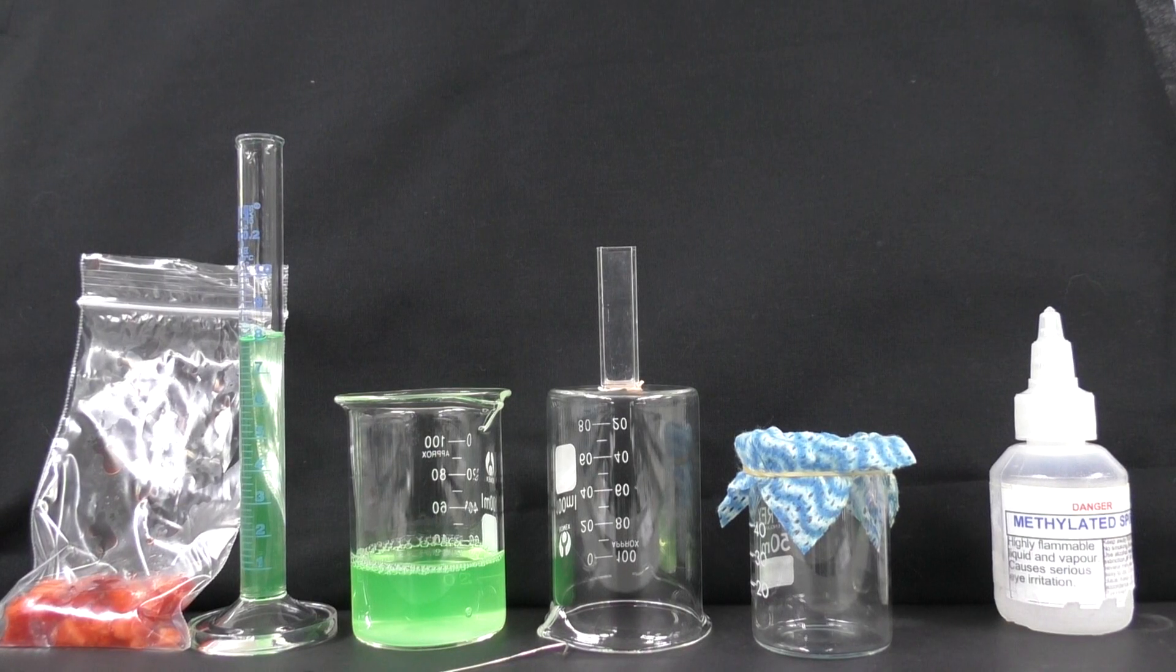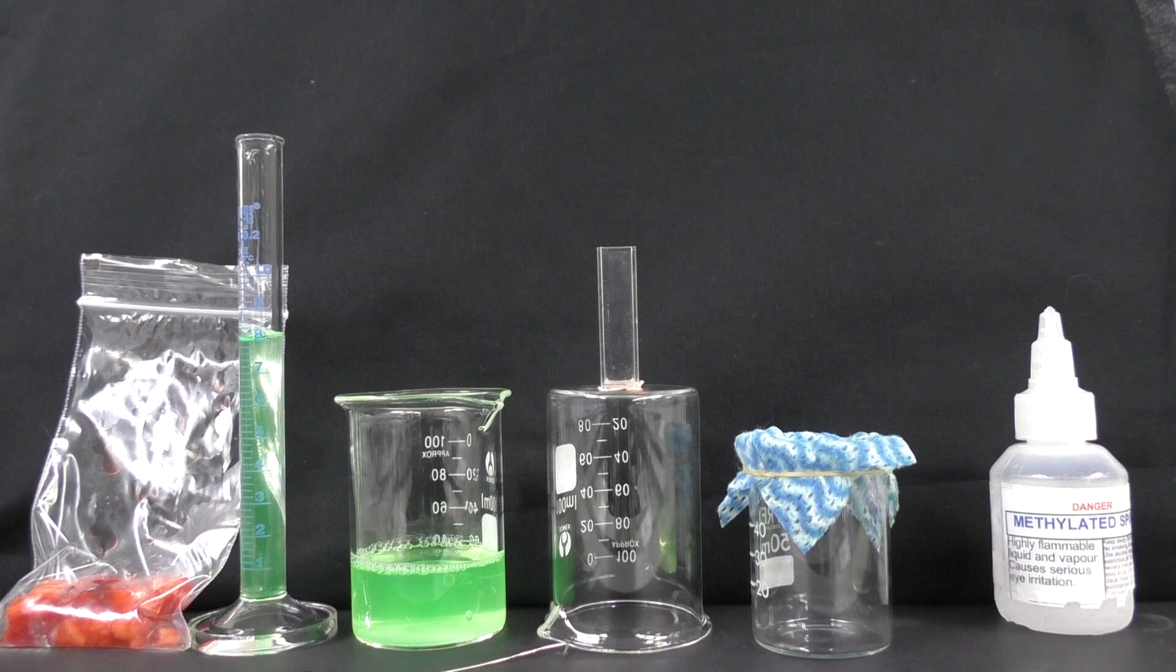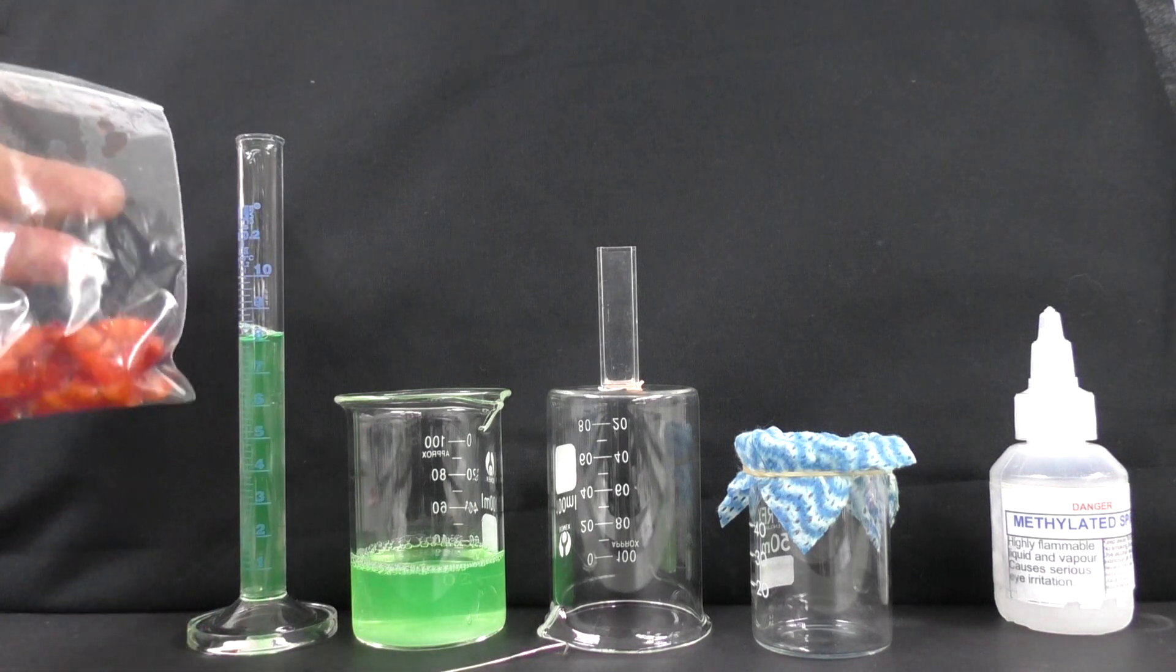In this experiment we're going to be extracting DNA from strawberries. We've got some strawberry here that's just been chopped up.